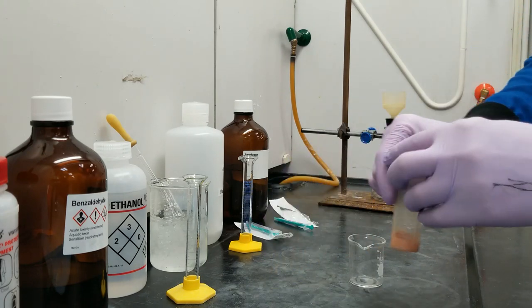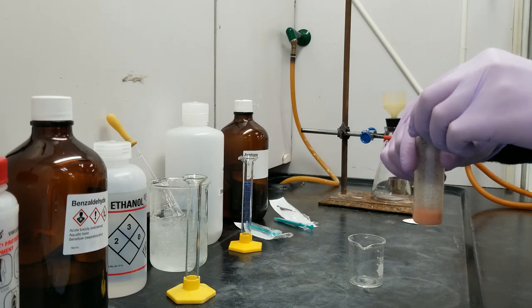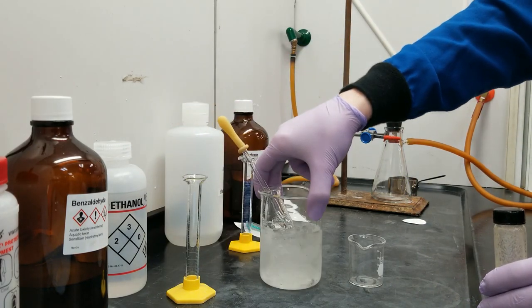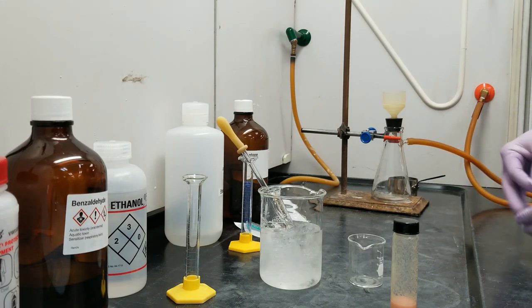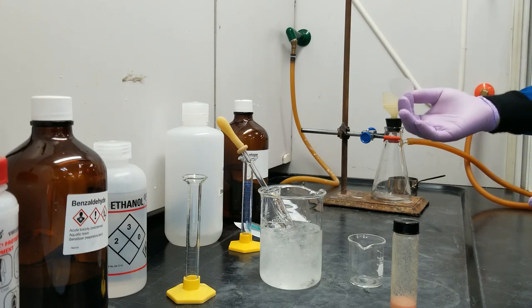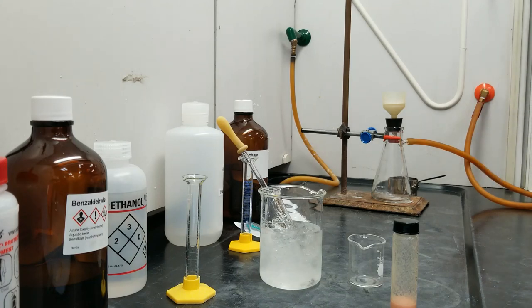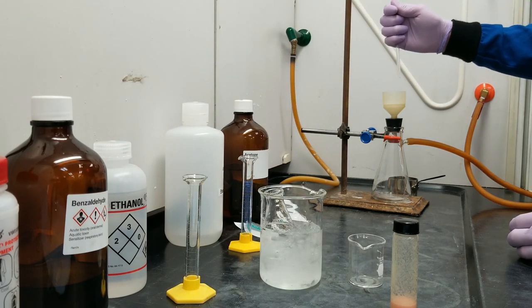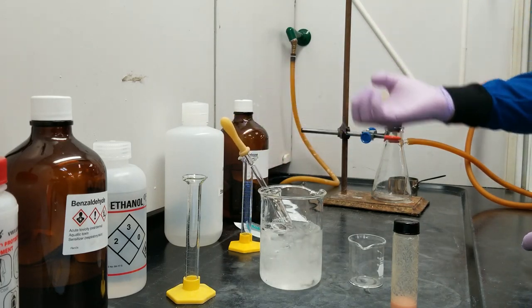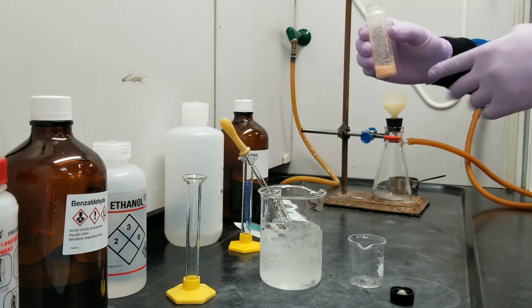Clean gloves. So after the shaking has been done, I've got ice water already ready. Here is my vacuum filtration setup. I've got a piece of filter paper which I've already weighed, so that later I can just weigh the dry product on top of it. That goes in, and I'm going to go ahead and turn on the vacuum — it sucks down the paper. I'll hit this with a bit of ice water so it's wet and sucked down, so there's very little chance of any solid escaping. Now I'm going to dump all of this straight on top.